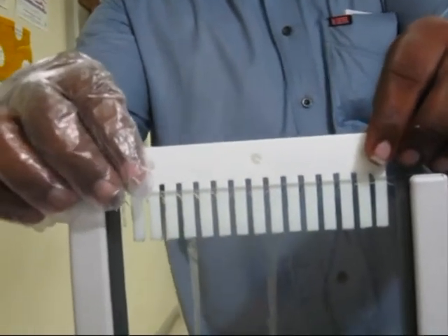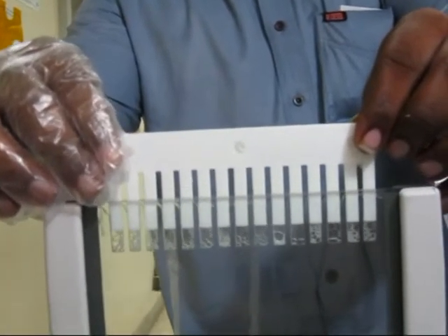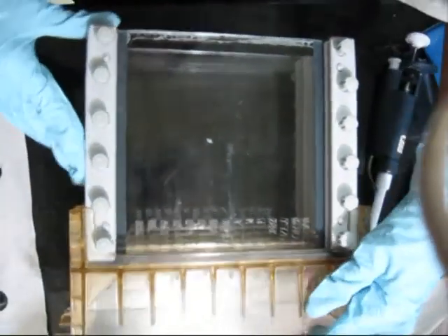After ensuring the polymerization of stacking gel, the comb should be removed gently. Most care should be given while removing the comb. After removing the comb, the setup is gently placed inside the unit.